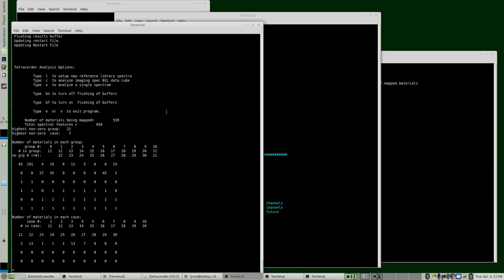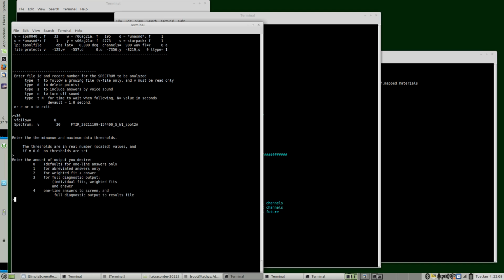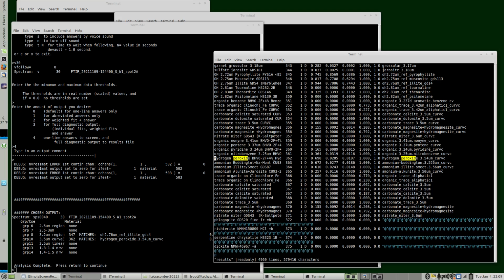So I've already done the setup here. We'll do single spectrum mode, V30, and just the output or the final answer, and lo and behold, we still have hydrogen peroxide. Let's look at the results file. We don't need to rerun and capture. The results file always has the full output. So we'll view that.